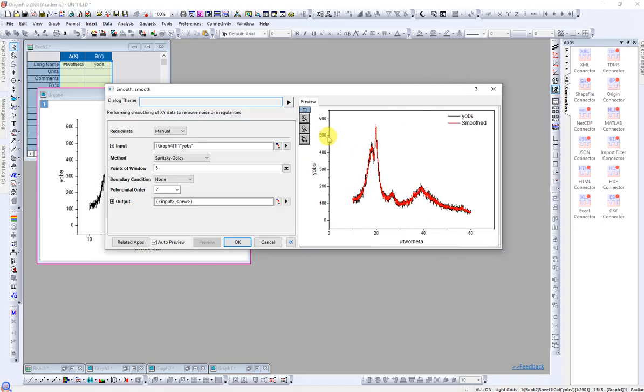Let's make it large. If you make it large, you can see, okay, still there is a lot of noise. So let's make it small, and let's change the points of window. We change the points of window to 10. Let's see how it looks. Oh, it looks better, but still there is a lot of noise. So instead of 10, let's choose 50.